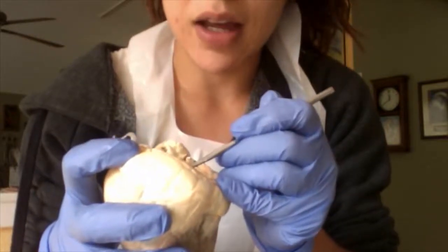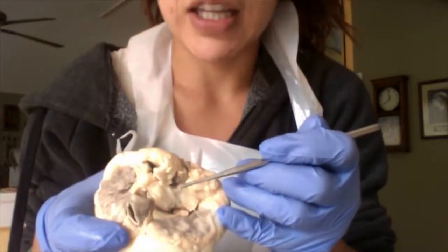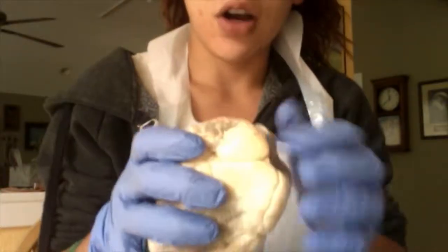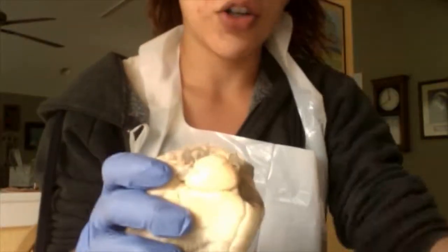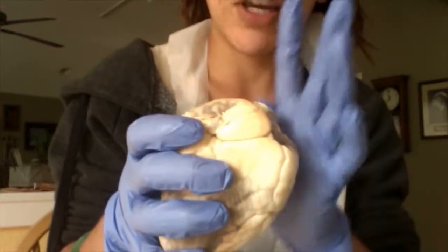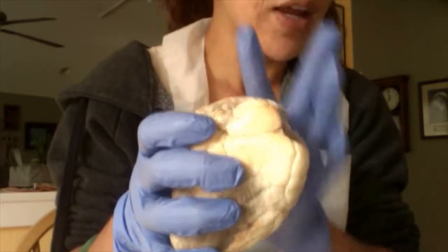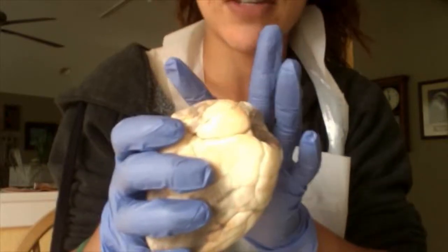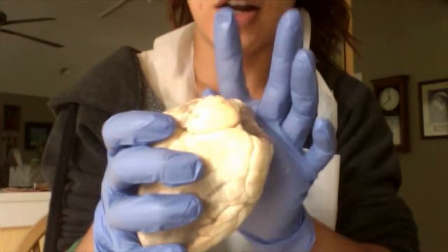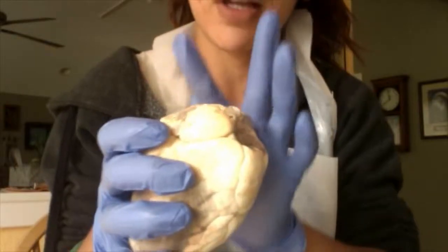And as there is no aortic arch, I cannot point out the brachiocephalic artery, the left common carotid, or the left subclavian artery. But if the heart were to show the arch coming up like this, on the rightmost side would be the brachiocephalic artery. In the center, we would have the left common carotid artery, and on the left side, we would have the left subclavian artery. So we go brachiocephalic up here, left common carotid here, and the left subclavian artery.